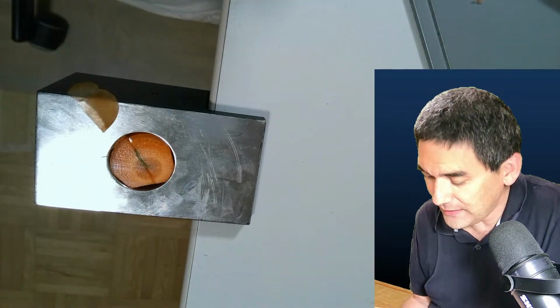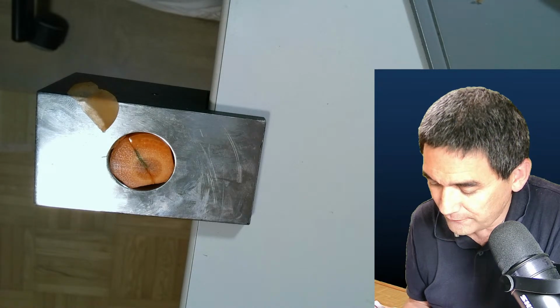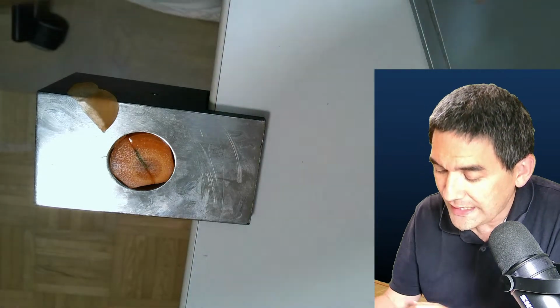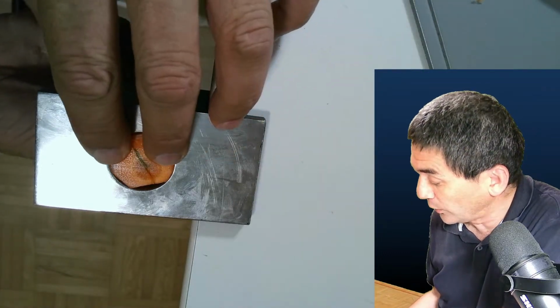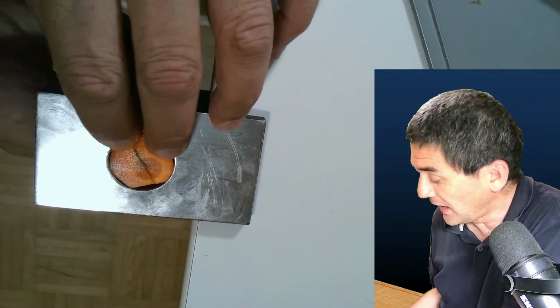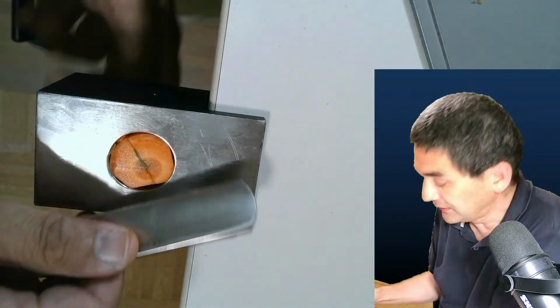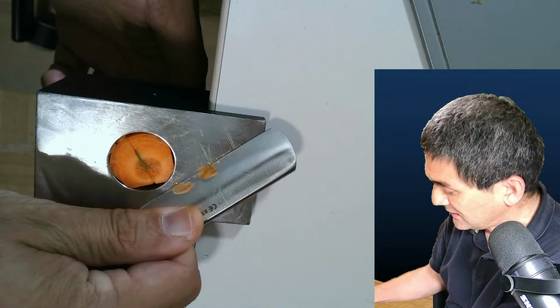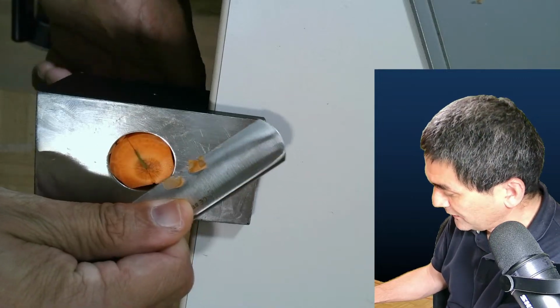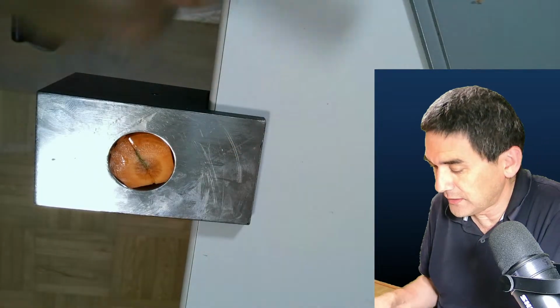Even though it is quite thin, I found out that it's in many cases still a few cell layers too thick. And because it's green, because of the chlorophyll, you still do not see the cells quite well. Okay, so I'm going to show you how you can actually remove the chlorophyll. And if you want, we can also look at the carrot. Okay, and you see sometimes it just slides over it. That's more of an issue of the knife. Okay, yeah, and here that's another one.